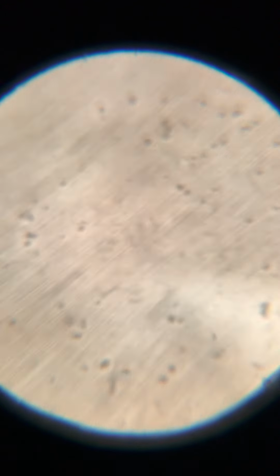Trying to see if I see any other bright colored minerals. Look at that. Look at that. That's plain polarized light, and you can see it's got color. So that might be useful, and also cleavage is there. That might be very useful. Look at it now in cross polarized light.